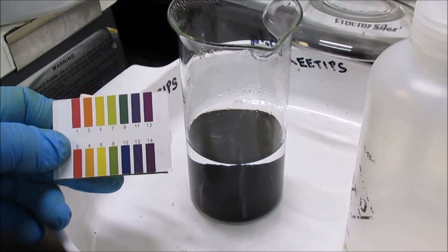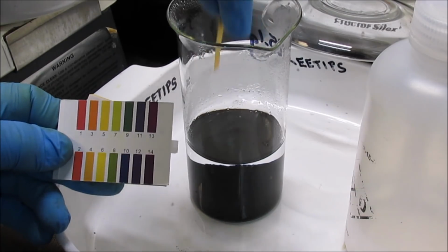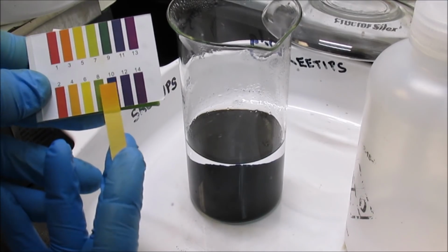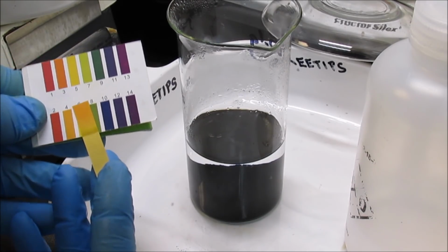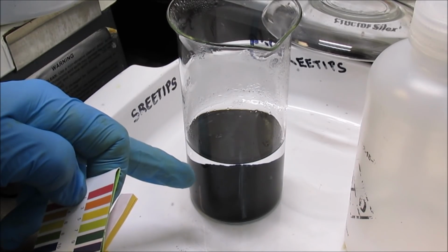This is rinse number 10, distilled water rinse number 10. And I've got a pH of about 4 there, it looks like. I'm shooting for a pH of 7, which is neutral. And that'll mean I'll have all the acid and dissolved copper out of that solution.